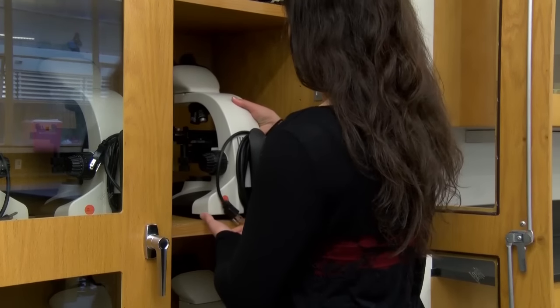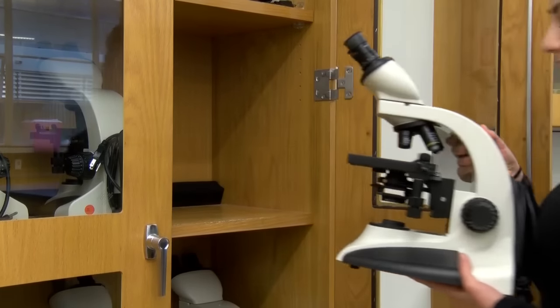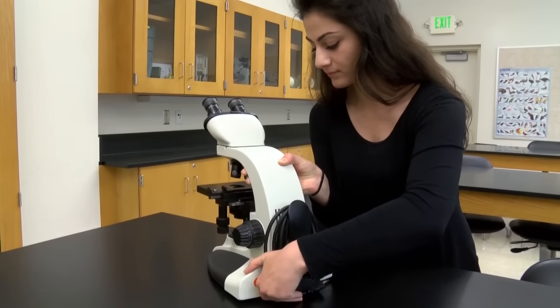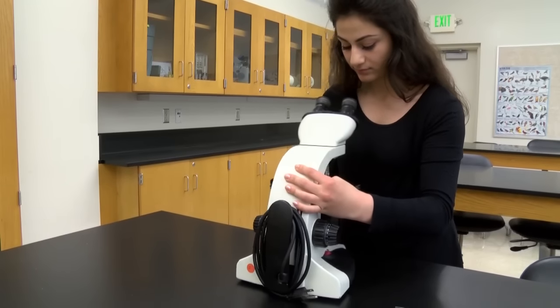Retrieve a microscope from the cabinet. Carry the microscope with both hands, one holding the arm and the other under the base of the instrument. If the microscope is too heavy for you to carry safely, ask for assistance.